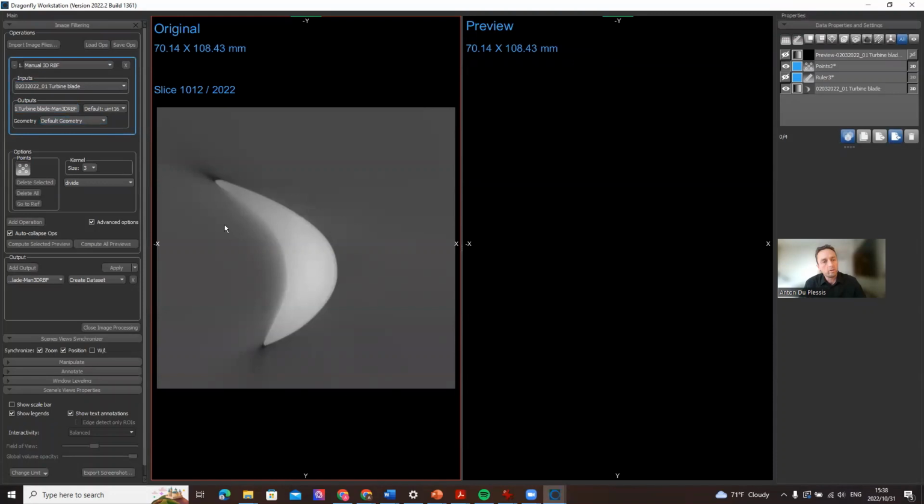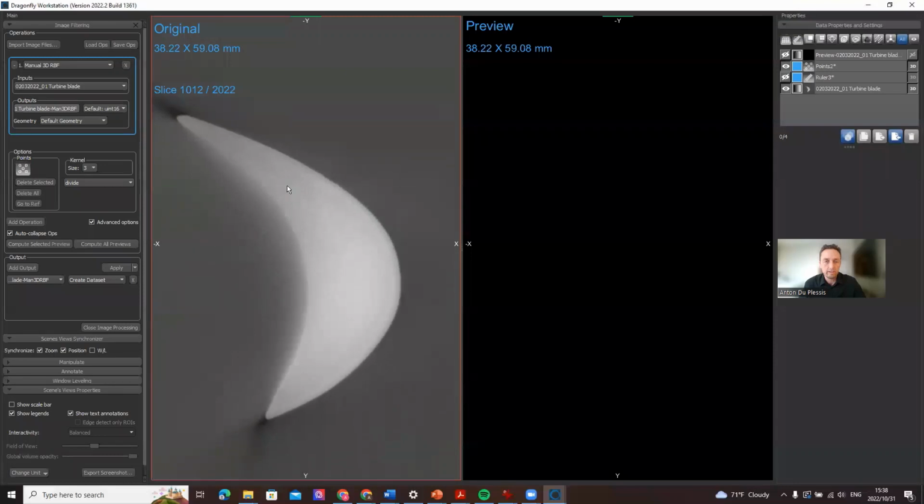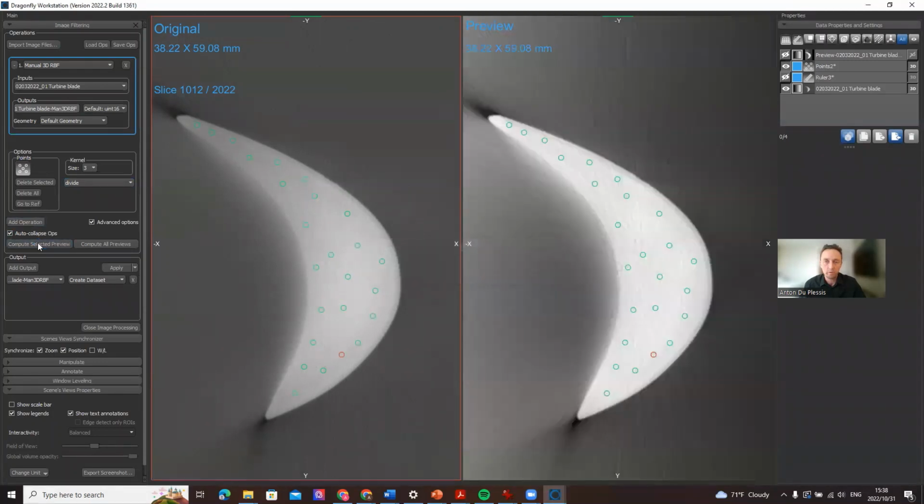How this works is, on the left we have the original data, and on the right a preview. If you use the mouse left click and select a number of points in the material, this is basically telling the algorithm that you want all these points to be the same grayscale value. If you click compute preview, you see that's very nice. The tip gets brighter and the middle stays the same. So all parts of the blade now have the same grayscale intensity.